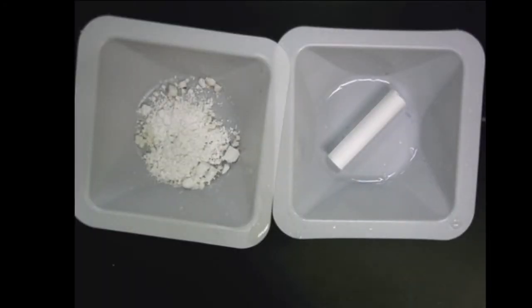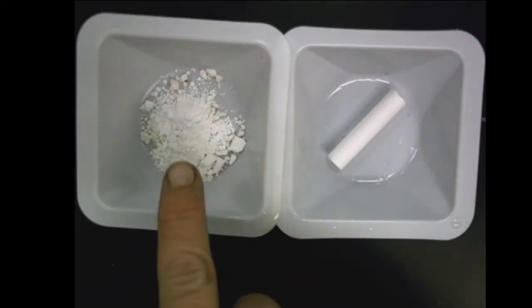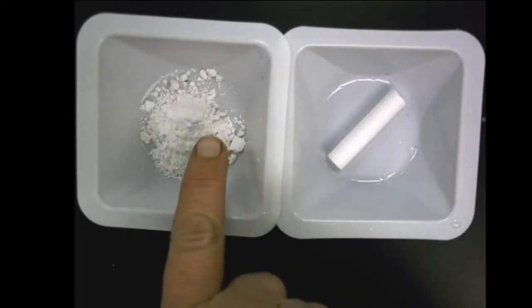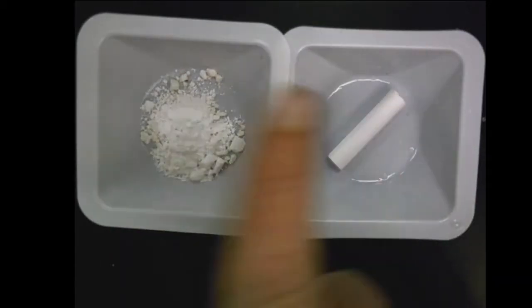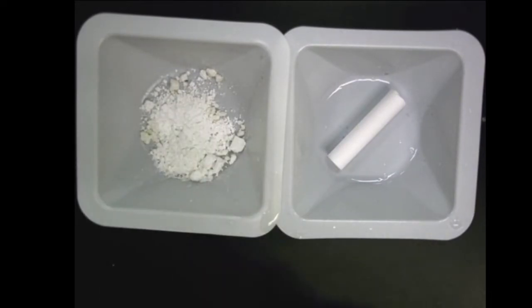Okay, here is our experiment for surface area. We have two pieces of chalk. It's the same chalk; I've just snipped them in half. So you have one side that's not crushed and one side that's crushed. Which one has the higher surface area? The whole or the crushed? I hope you said crushed. Crushed has a higher surface area.